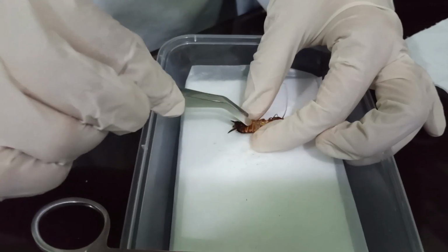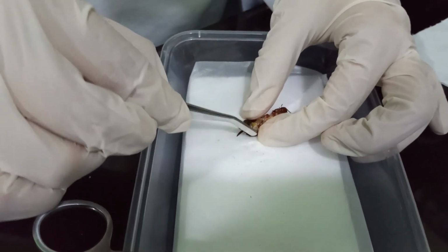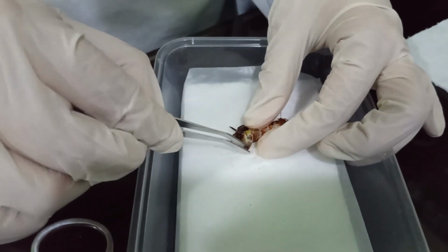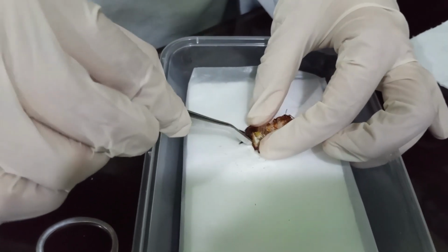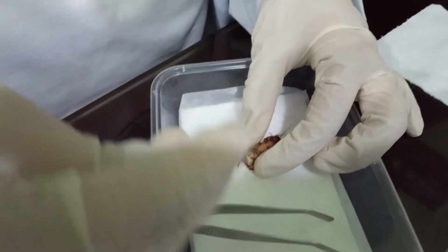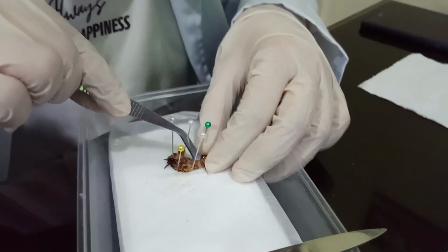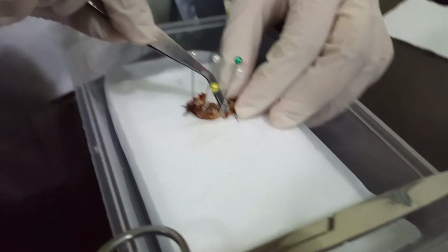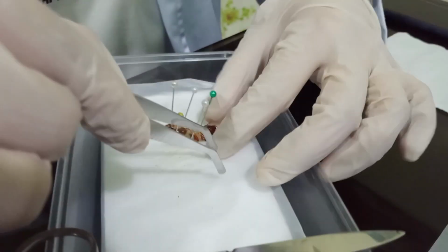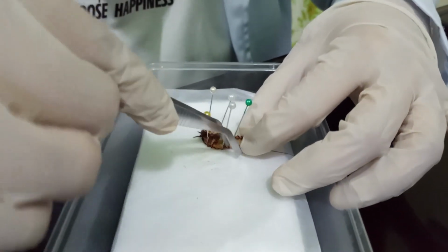Thereafter, the lateral membrane in the sterna of the thorax and abdomen was cut using a scalpel. The incision was extended on the posterior part of the cockroach's abdomen up to its endmost and extended forward into the anterior part in the thorax. A transverse incision was then made along the anterior border of the first thoracic segment, and the terga was opened, extending up to the thoracic part, exposing the inner parts of the cockroach.